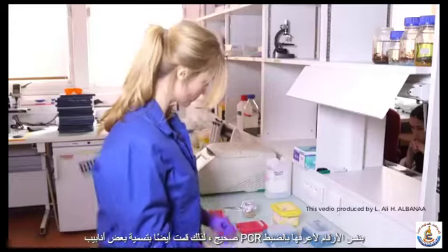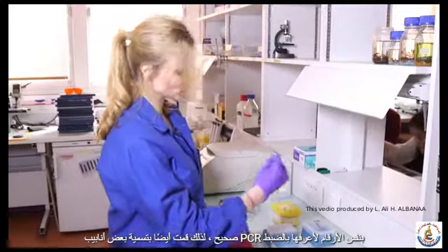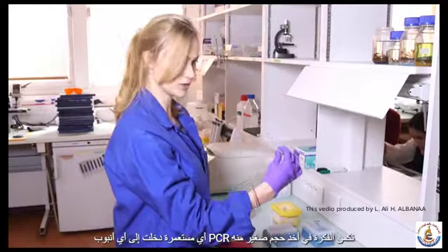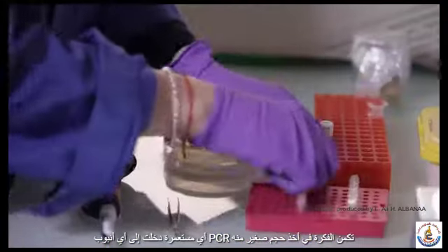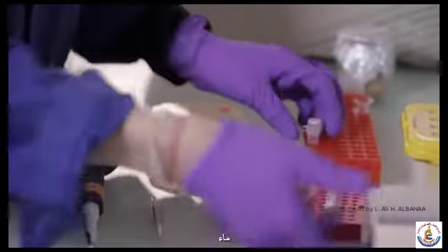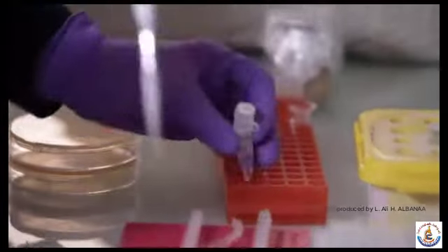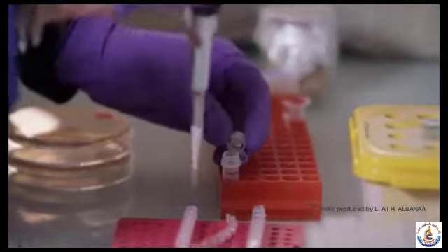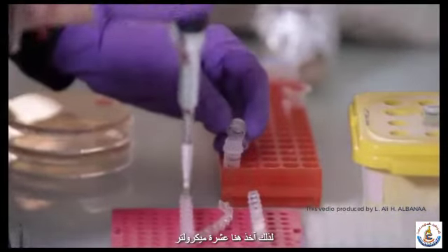Alright. So I also labeled some PCR tubes with the same numbers to know exactly which colony went into which PCR tube. The idea is to take a small volume of water. So I'm taking 10 microliters here.